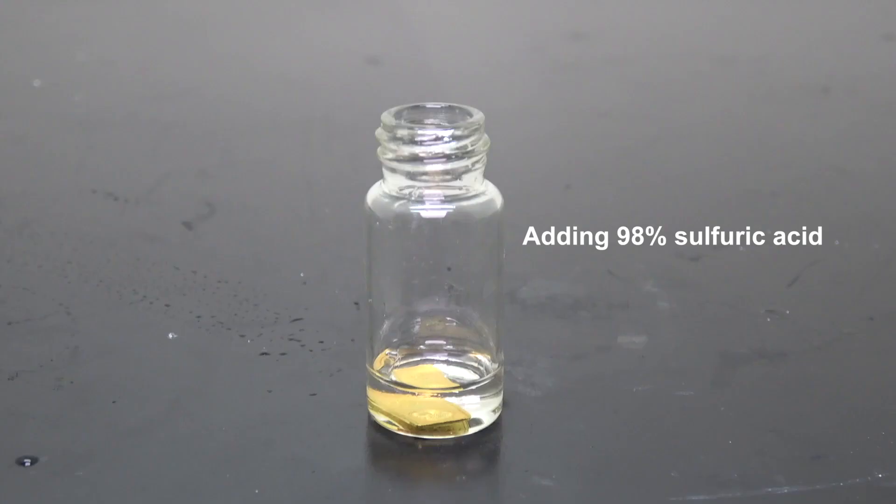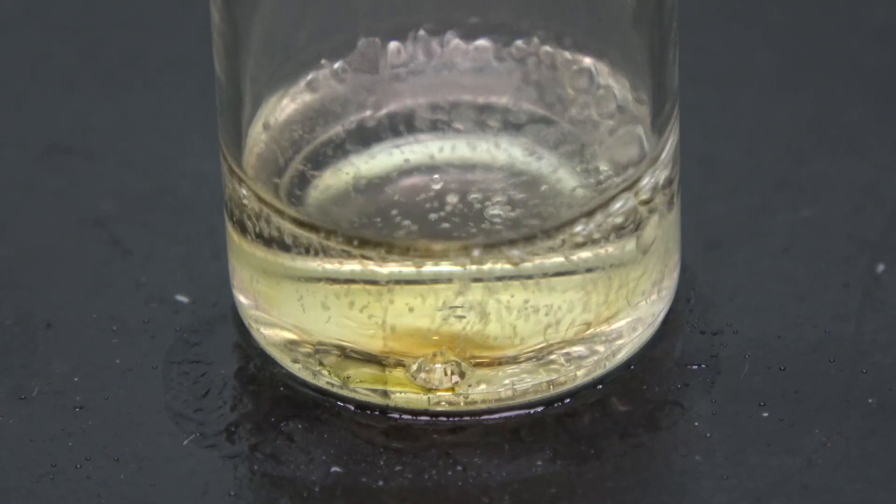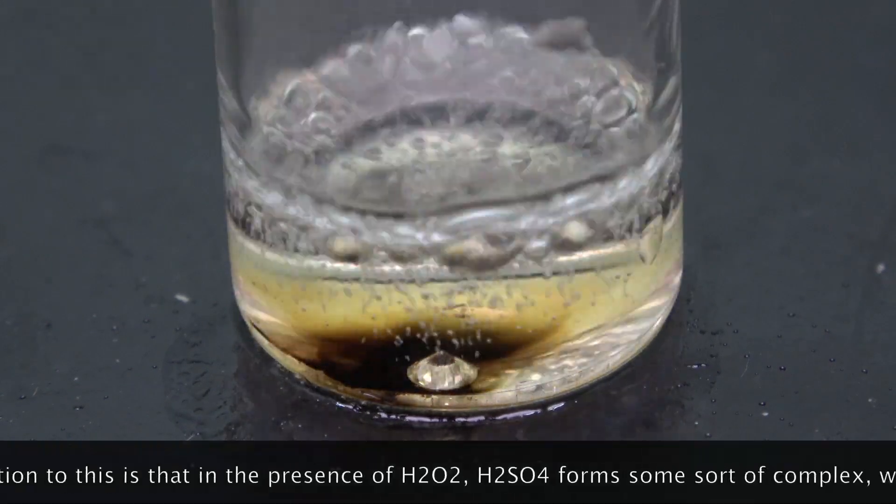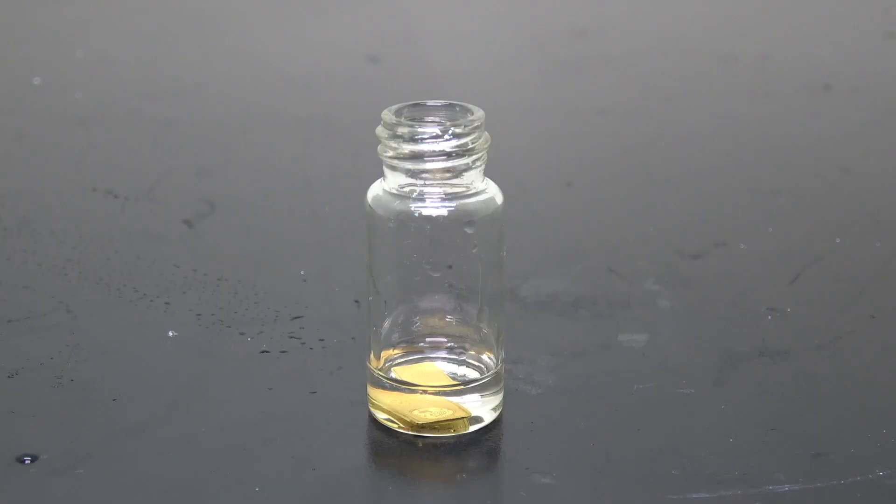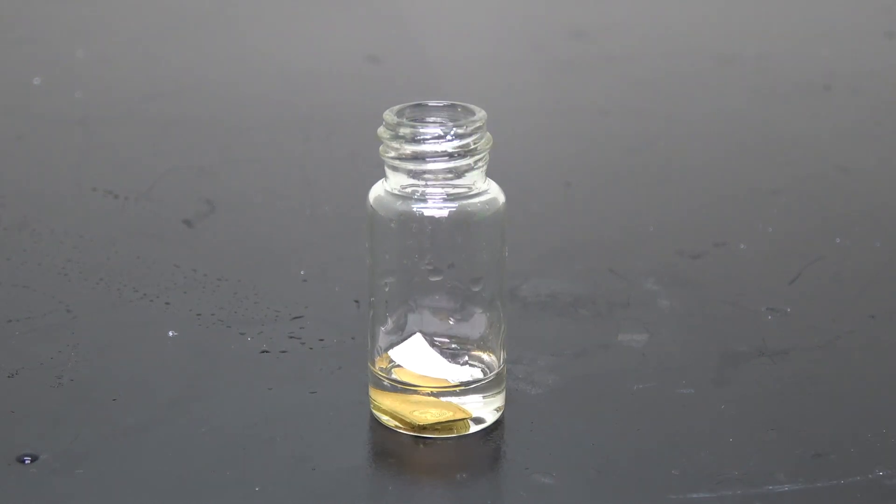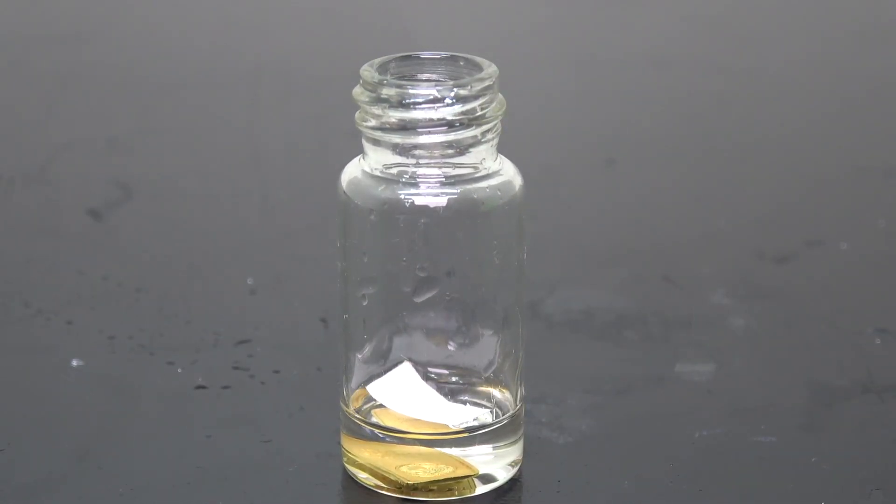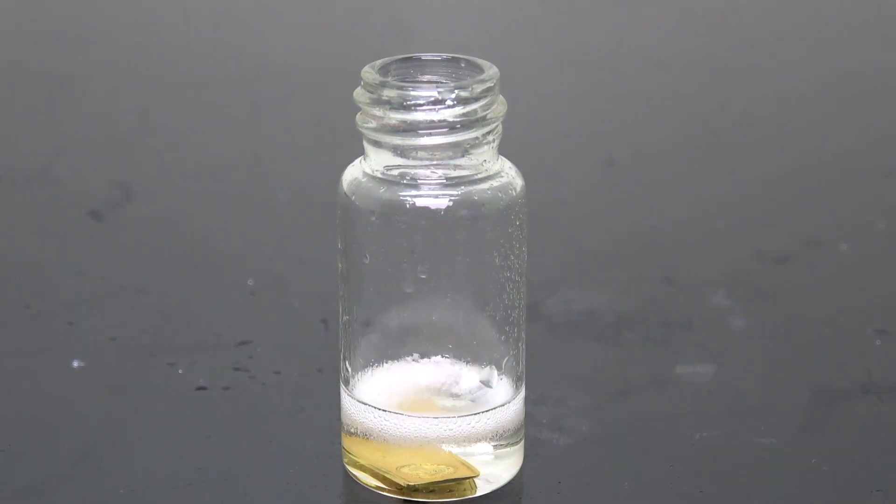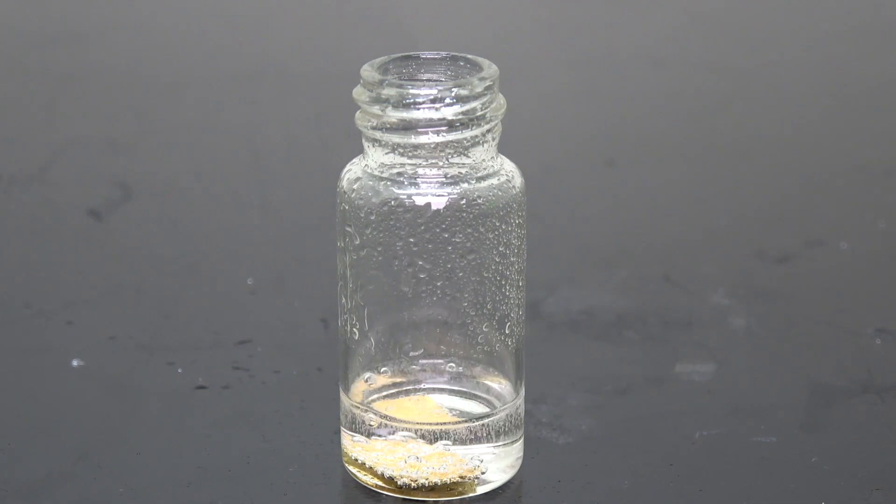Okay, let's try something new here. How about some piranha solution, the very mixture that's capable of disintegrating diamonds. I'm gonna throw in a piece of printer paper. Of course, nothing happens yet, but wait until I add the final ingredient. Wow, that was fun.